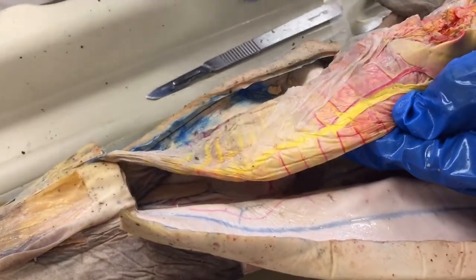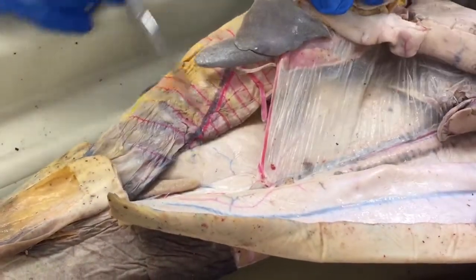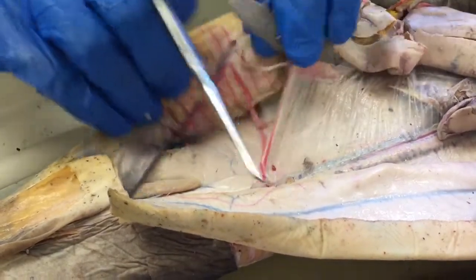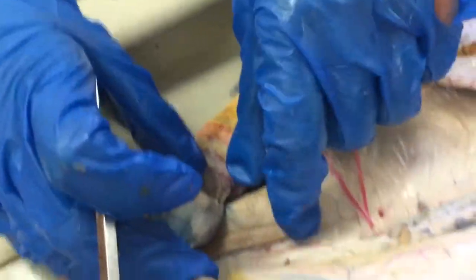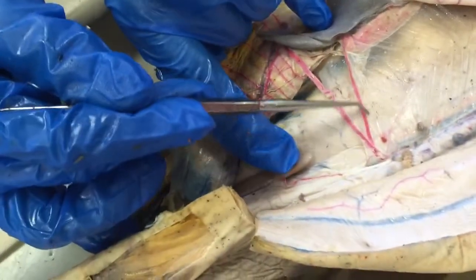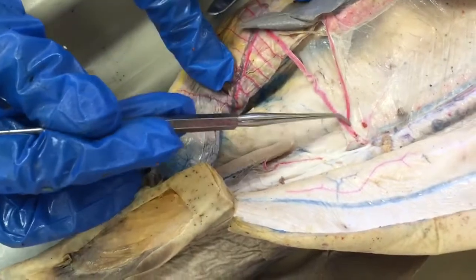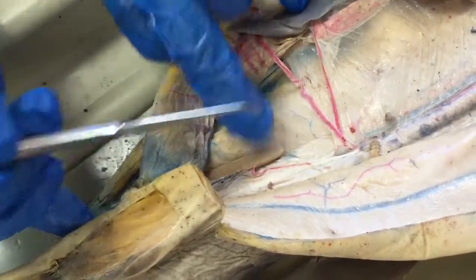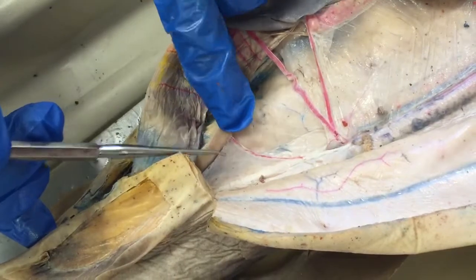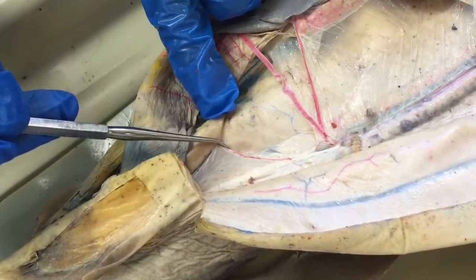Up here it's anterior intestinal artery and vein; here it's posterior intestinal artery and vein. Looking in this view, we've got our rectal gland here, the gastrosplenic artery, the anterior mesenteric artery, and then the one going to the rectal gland here is the posterior mesenteric artery.